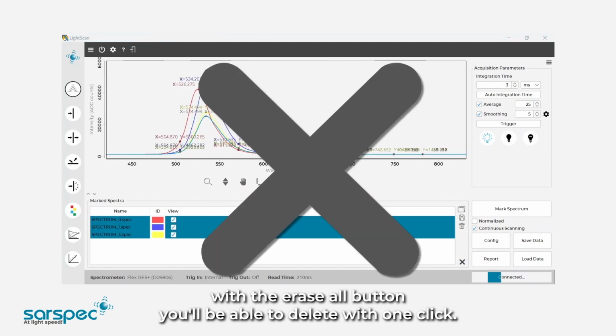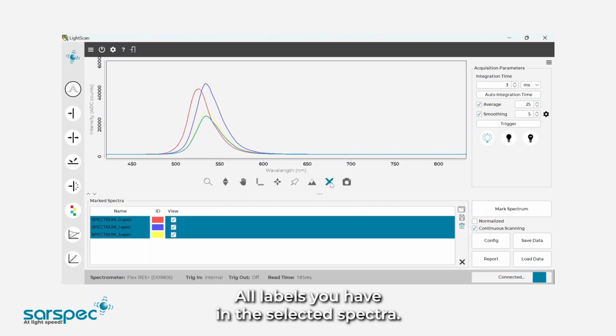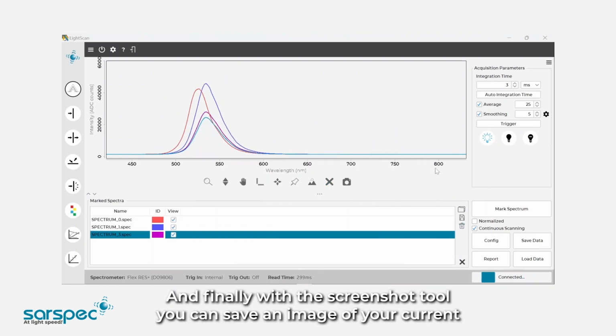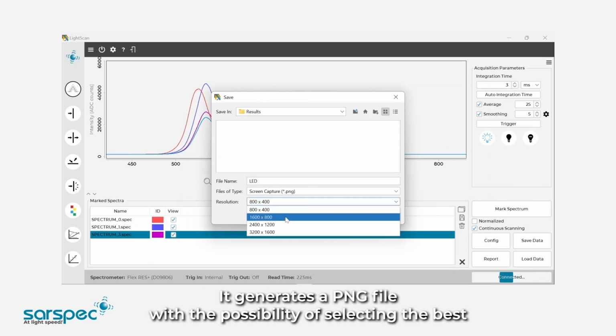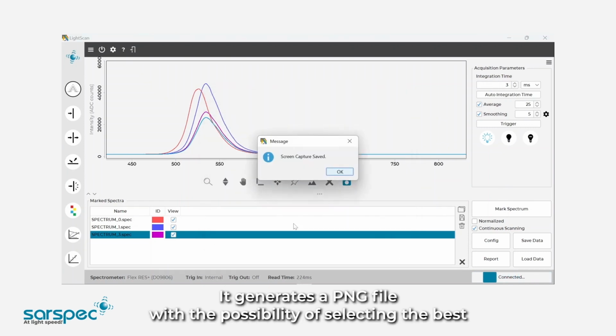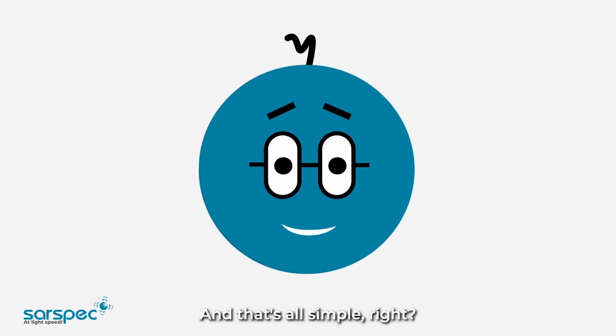With the Erase All button, you'll be able to delete, with one click, all labels you have in the selected spectra. And finally, with the Screenshot tool, you can save an image of your current spectra area. It generates a PNG file with the possibility of selecting the best image resolution for you. And that's all. Simple, right? Cheers!